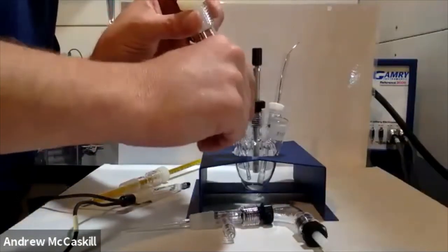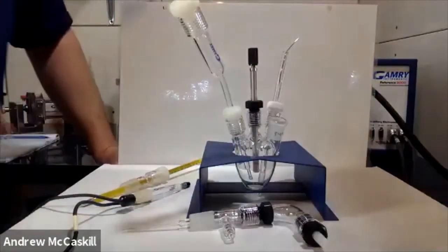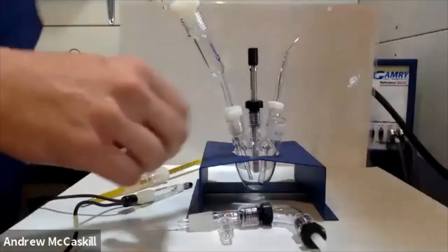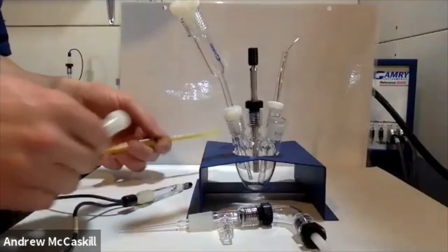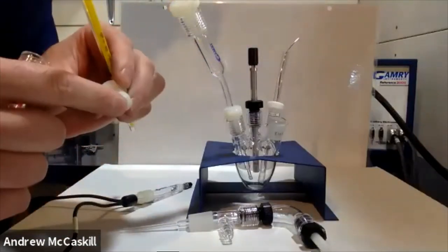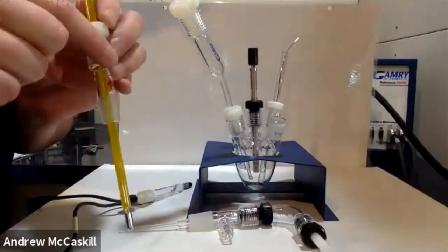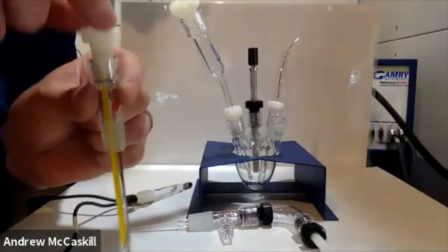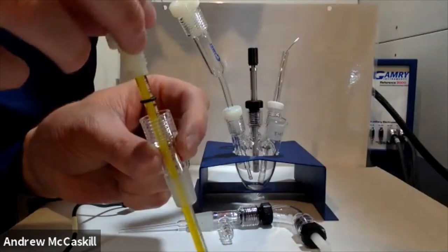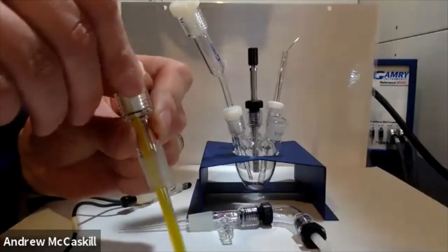It's actually designed to go the other way. You take your fitting, put that on first, then slide the o-ring to whatever height you need — because down in the bottom of the cell it tapers in a bit and that o-ring lays against the surface of the glass. The point of doing this is it seals the cell. If you're creating any gas product it won't escape; if you need to blanket with an inert gas, the ambient lab gas won't invade the cell. Make sure the o-ring is placed on the inside prior to sliding the fitting in, then screw it in to add pressure and create a seal.